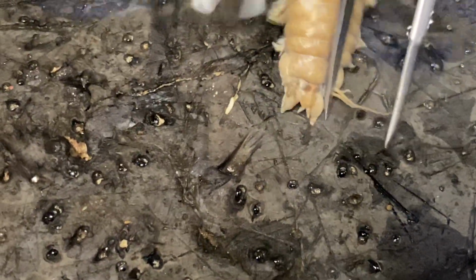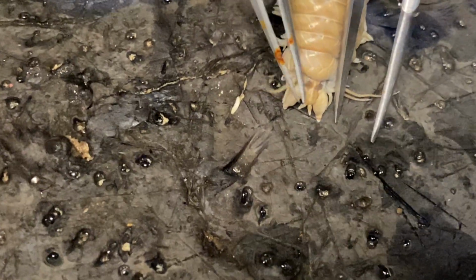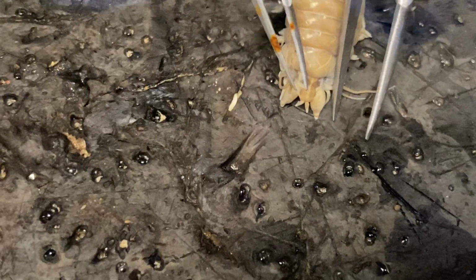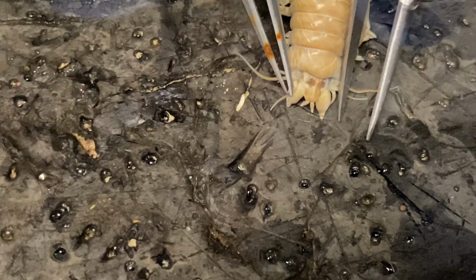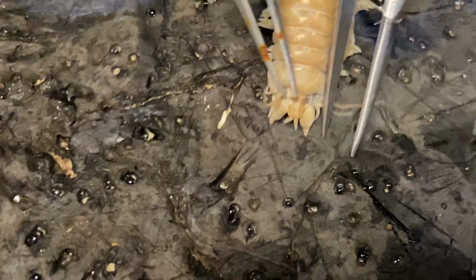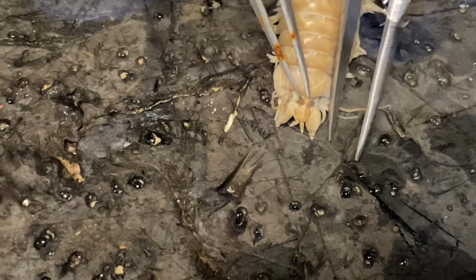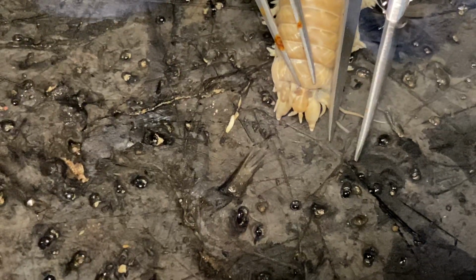Coming from the prostomium, you have two antennae right there. And then on either side of the prostomium below it, coming out terminally, are these palps, 1 and 2 palps. These dark spots on the top of the prostomium are eye spots. There's actually 4, 2 there, and then 2 kind of tucked behind there.